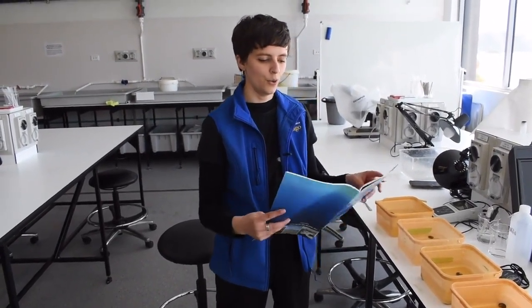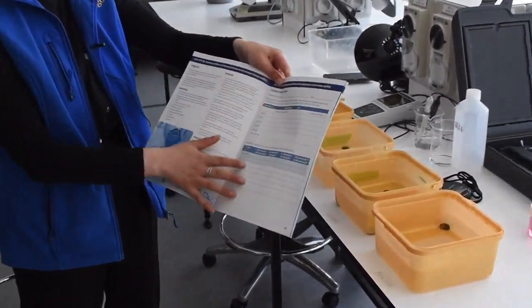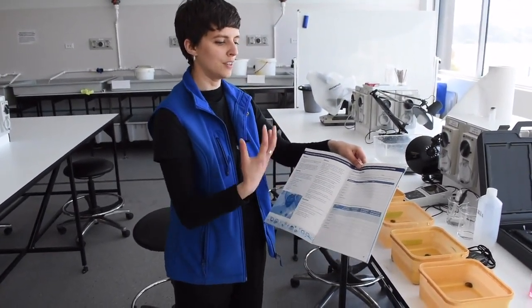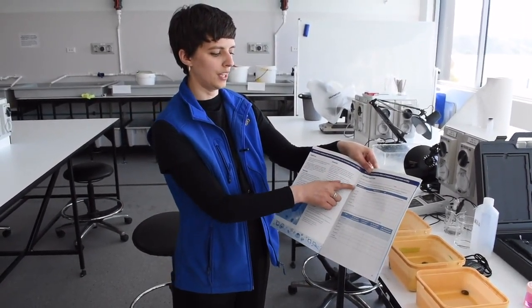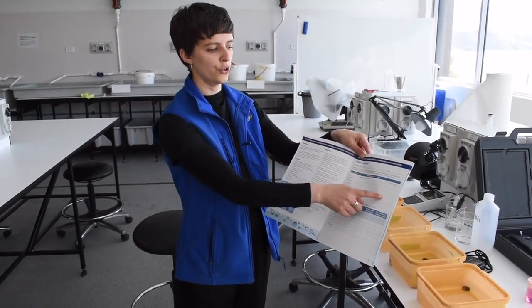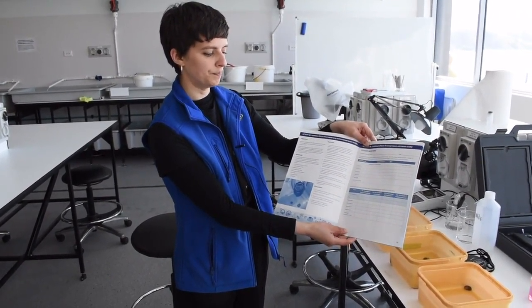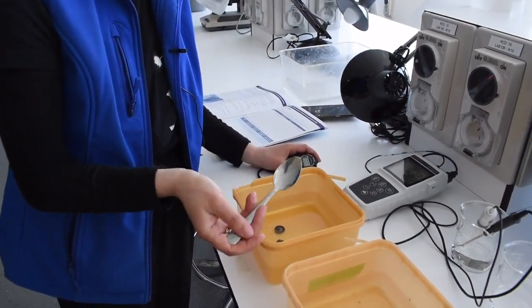We also want to make sure we have our data sheet ready, so you'll be recording all of your information on the other page. This is a great activity to do in groups, so if you're working with a big group or classroom, you can split them up and have each group look after one of the experiments. Each group would then look at the behaviours they've observed for each of their 4 snails and the turnover time, and then the data from the group or class would be compiled in this larger spreadsheet.